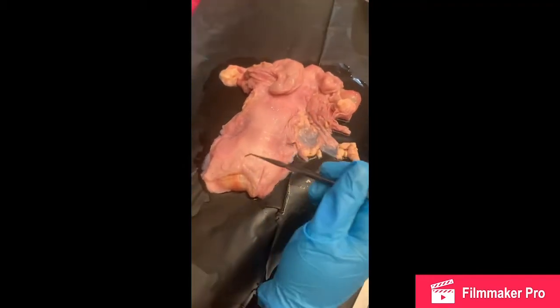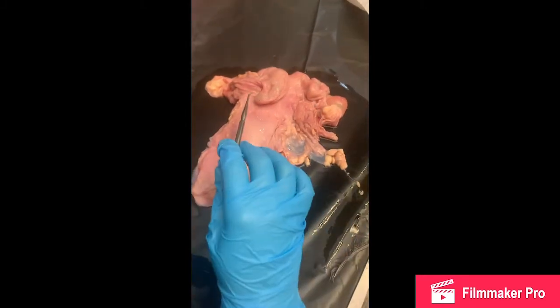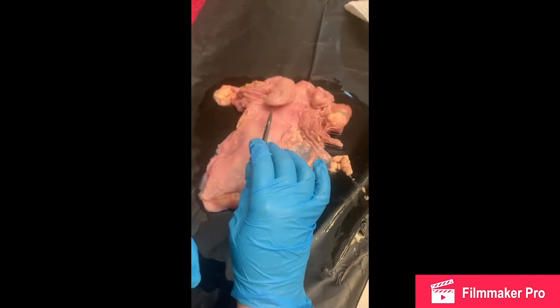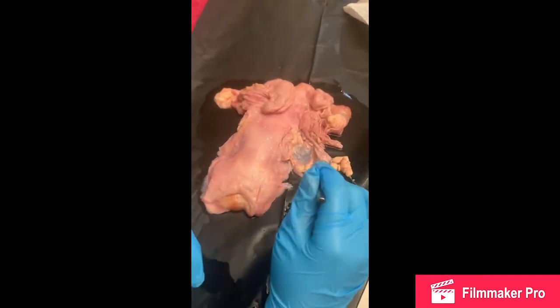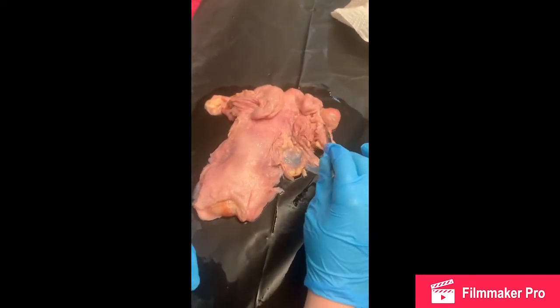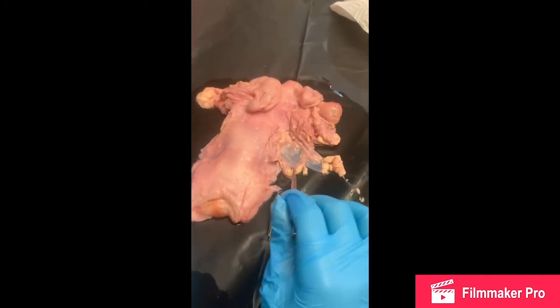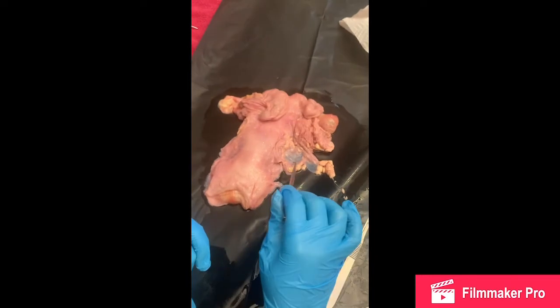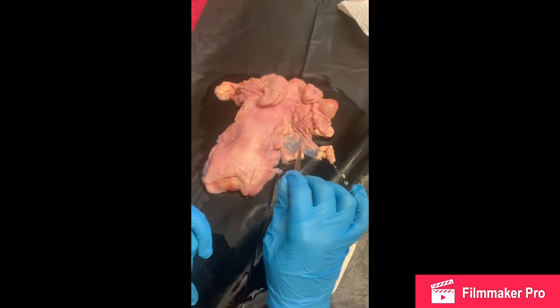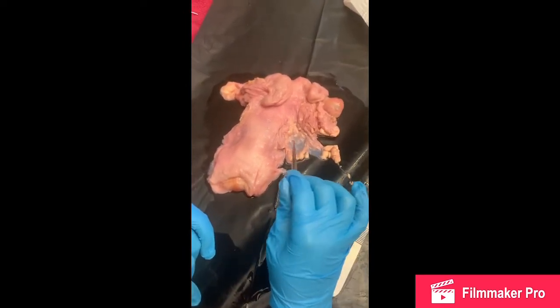Okay, so first I'm just going to start with some simple structures that we can see here in our reproductive tract. So right here we have what would be considered to be our uterine horn, and then we also have an ovary right here, as well as our infundibulum, which is way down here. You can see the structure right here for that, as well as how it goes right here.